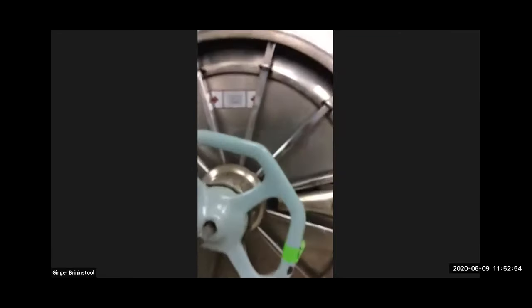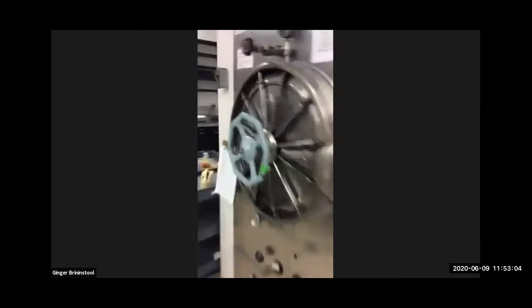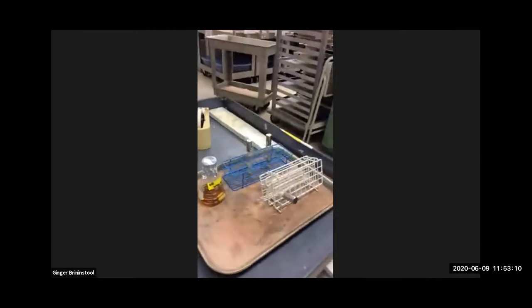We're not going to stand here for 15 minutes. Don't worry. That would be a horrible use of time. But it's going to autoclave, and I'll take it out later. You've already seen the end part of it. I did want to point out something, though, before we head down to lab to swab places.